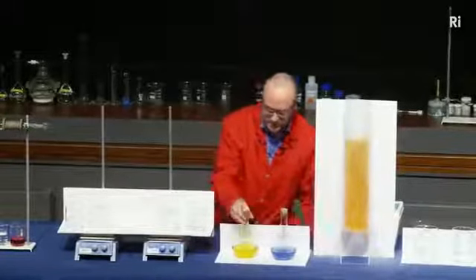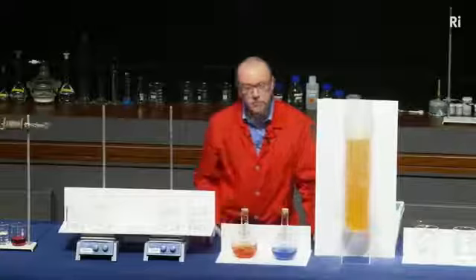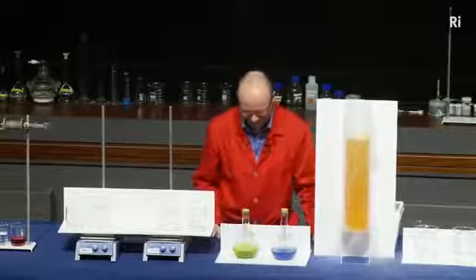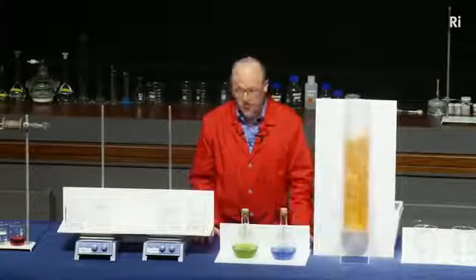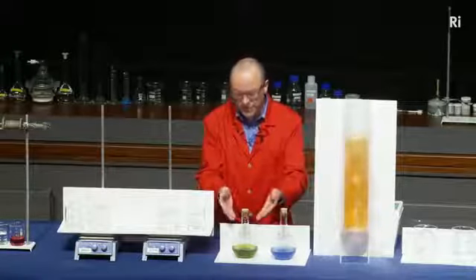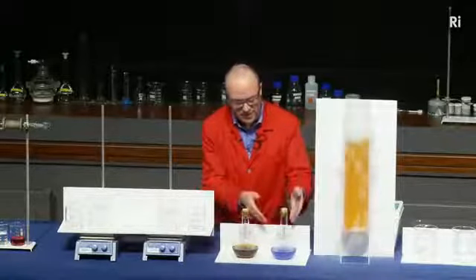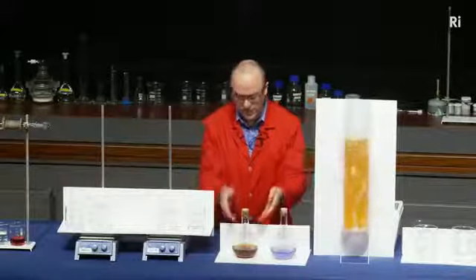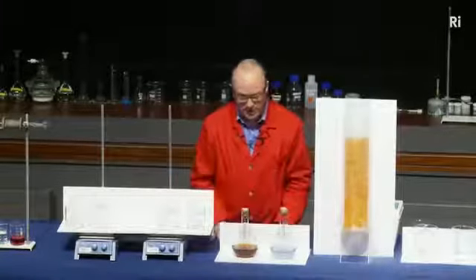Here's another flask. It's a similar idea. This is a yellow liquid. If I shake it, it turns red. And if I gave it a really good shake, it turns green. Now, something else rather surprising about this as well. If we keep watching, the green is turning back to red. And if we look here, the blue is turning back to being colourless. In fact, the red will go back to being yellow. So it's going back through that sequence of colours again.